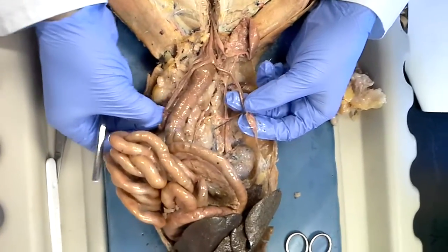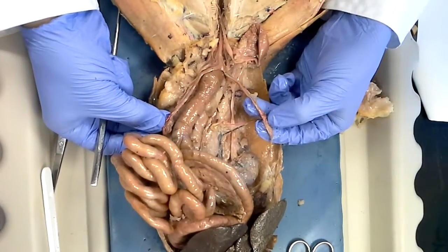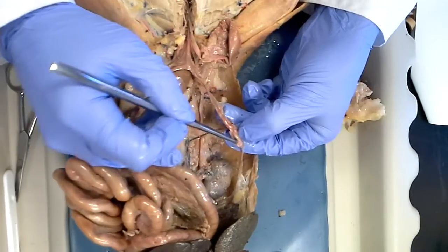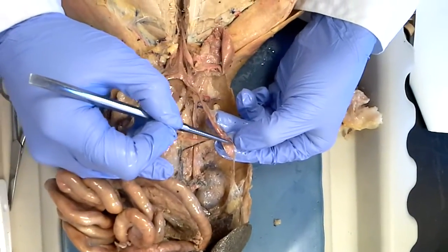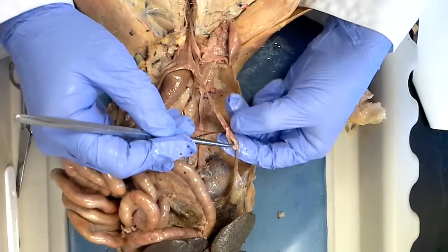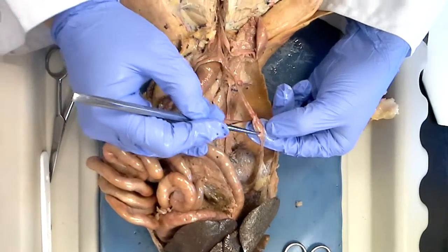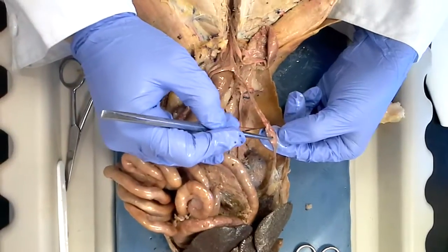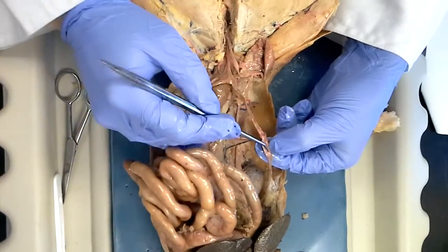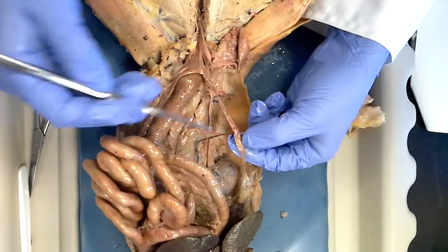Question: how would you separate the ovaries and oviduct on the test? You'll be able to tell if I have the pin in the ovary itself or in the oviduct. If it's hard for you to see, ask me to come over and clarify — I can verbally or with my pointer indicate which structure to name.